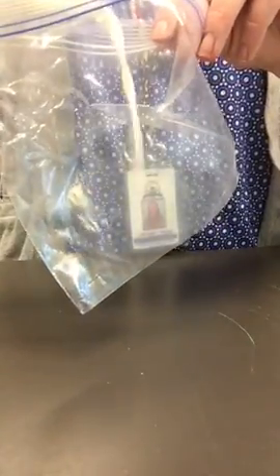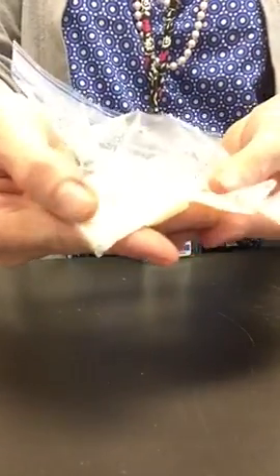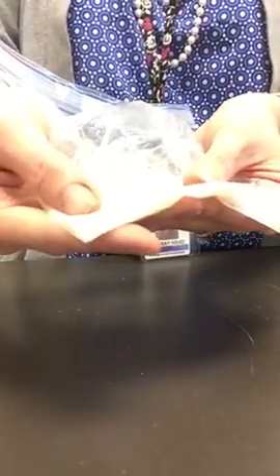Now, we finished with sample 1. We'll do samples 2 and sample 3. So now I'm going to mix them, let's see what reaction happens. Coming out. And if you look closely, you can see little particles. Little solids have been created, and that's that fancy word, precipitate. So samples 2 and 3 created little tiny precipitates.